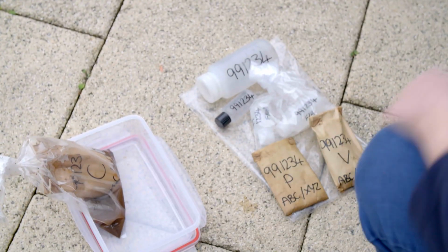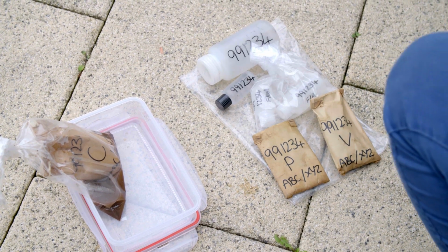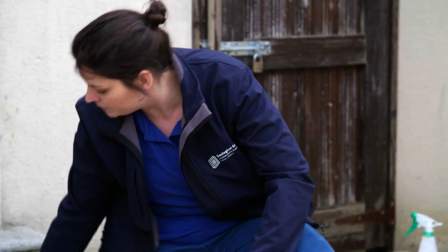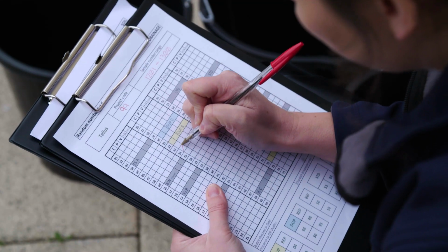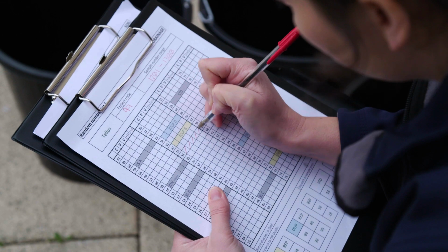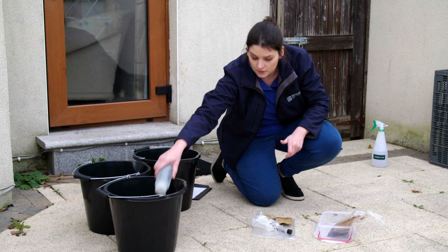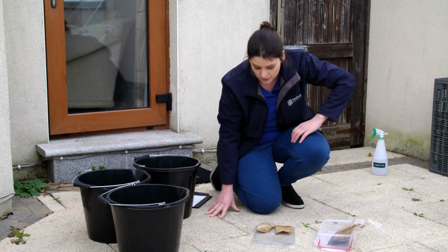Note that, by default, there must always be a stream sediment C sample present if there is a heavy mineral pan concentrate P sample. All physical samples must be checked against the drainage random number checklist. Ensure all the samples required from each site are present and that all the site numbers correspond. Gather all samples by type and by field 100 batch and take the stream water sample bottles back to the field laboratory.